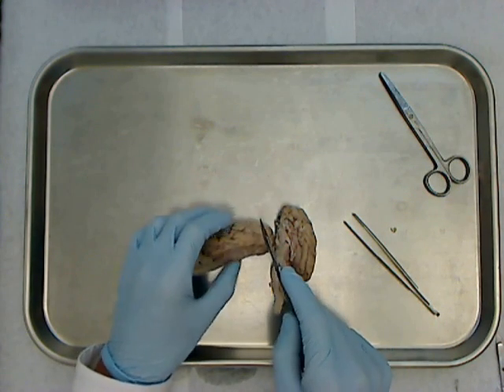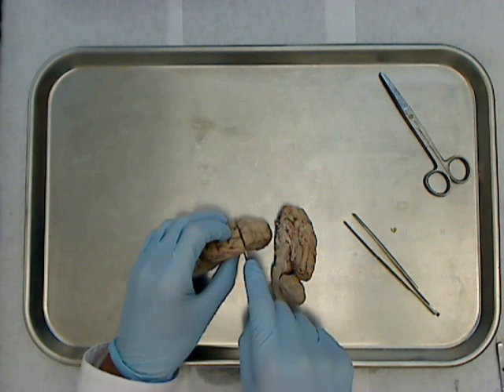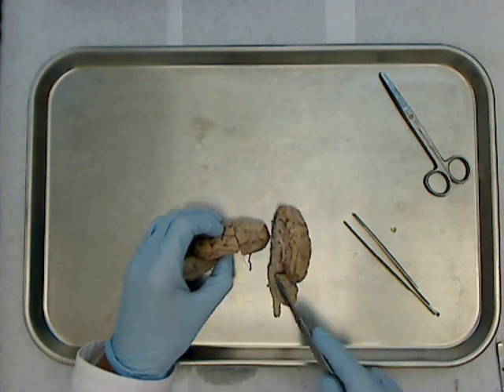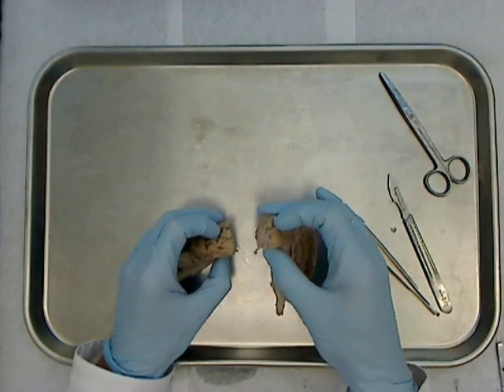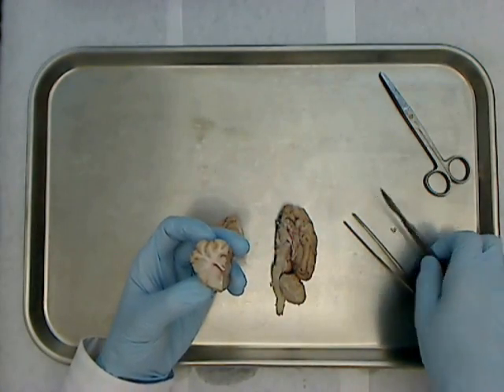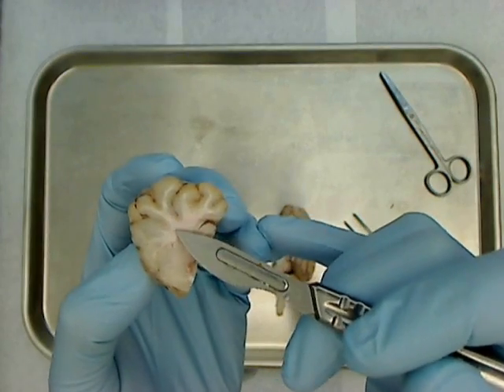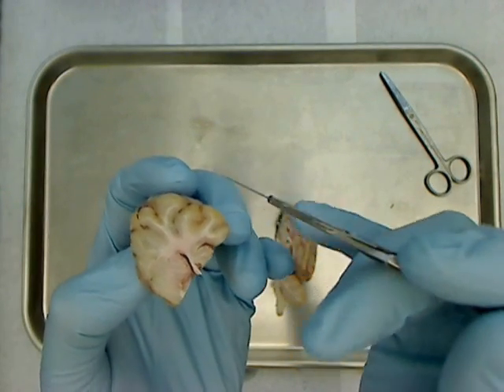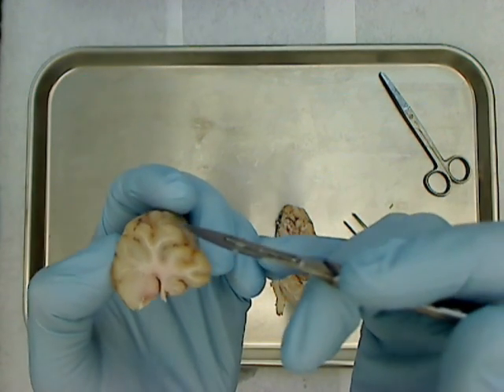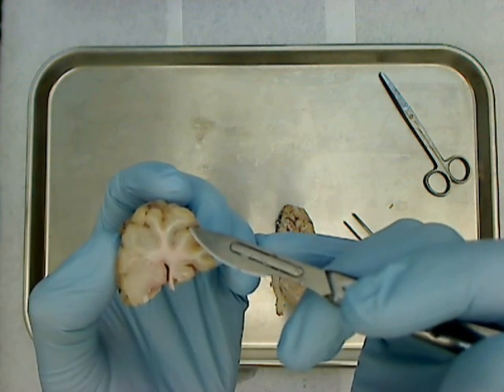Another dissection that we like to do is a frontal section. So I'm going to make a cut straight down through here, all the way through the brain. What that creates, of course, is a front part and a back part. This section really nicely allows you to see the white matter of the brain and the gray matter of the brain. The tops are gyri — so this is a gyrus — and then these valleys between the gyri, which are called sulci or sulcus.